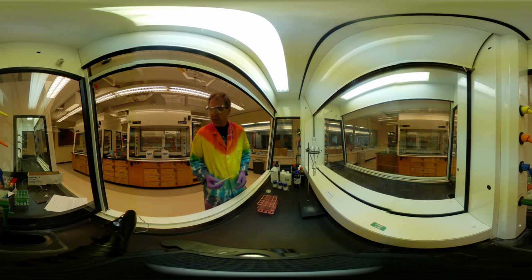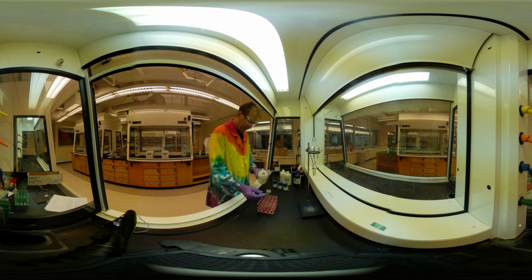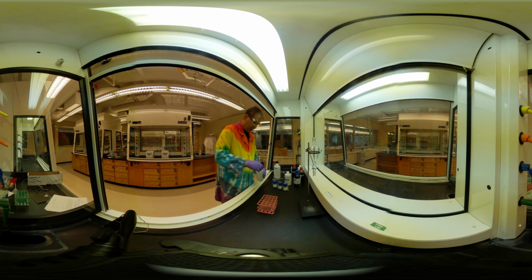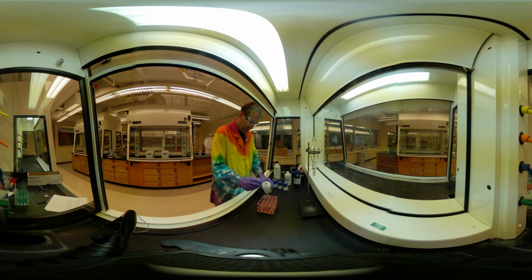I've pre-labeled them all. So my first column is going to be the water. I'm going to put in about 1 milliliter of water, or we'll do about 2 mils each time. So put that in. Okay, so we've got our water in here. Next we're going to put in the 5% hydrochloric acid. Okay, so we'll go ahead and start putting that in. These transfer pipettes hold a little over 1 milliliter, so we need a couple shots of this.